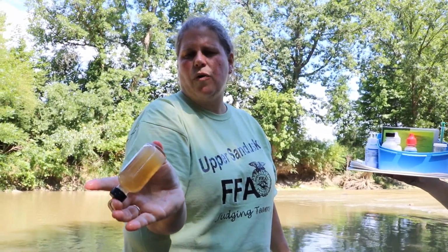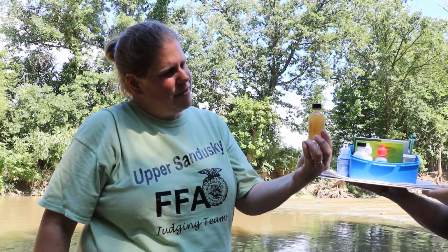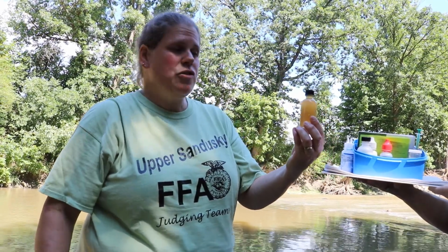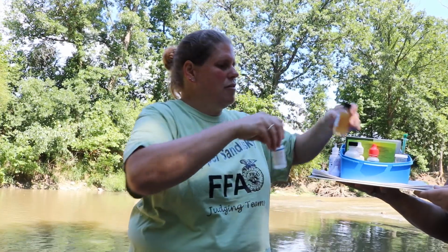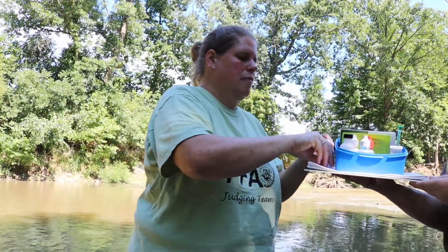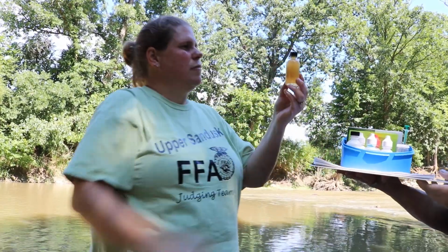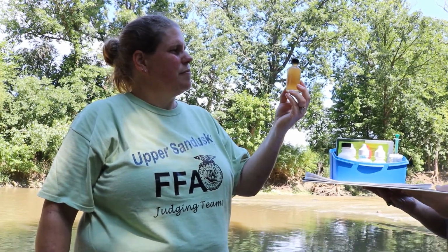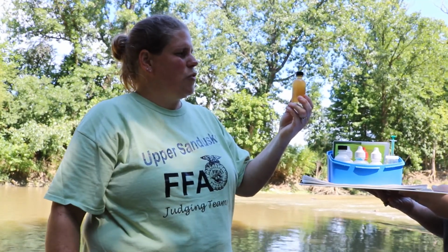We want to mix the chemicals, and we're going to wait for this precipitate to settle down below the neck of the bottle. Depending on how much oxygen you have in there, that might take a little bit of time. So I'll let that sit. Settling. Those are nasty floaties.